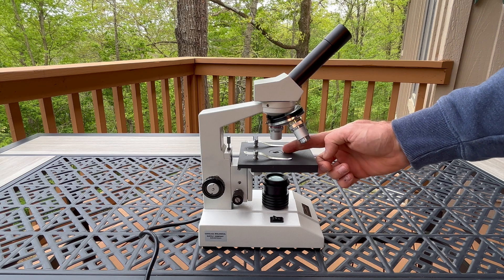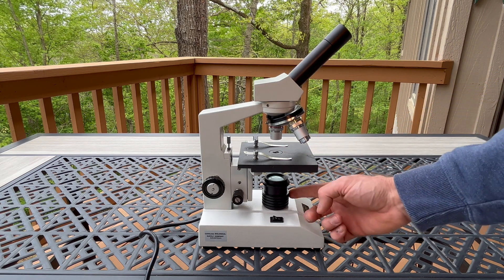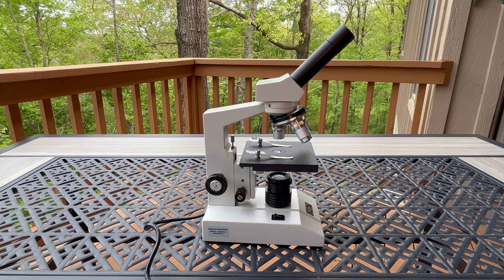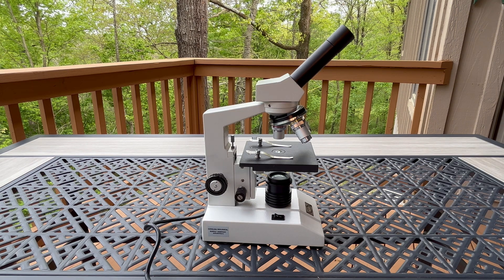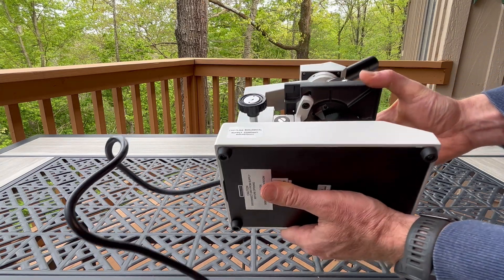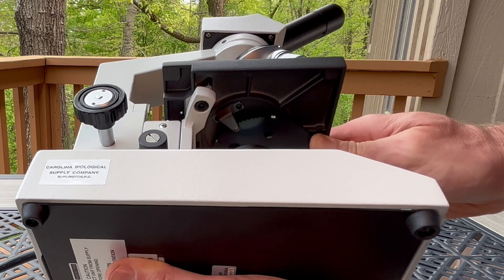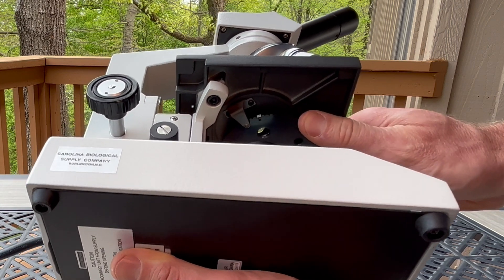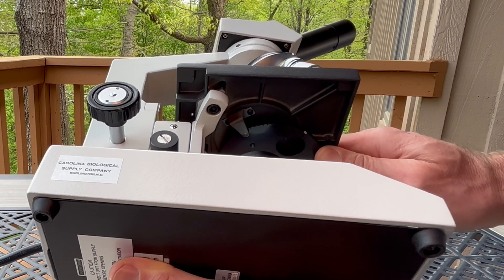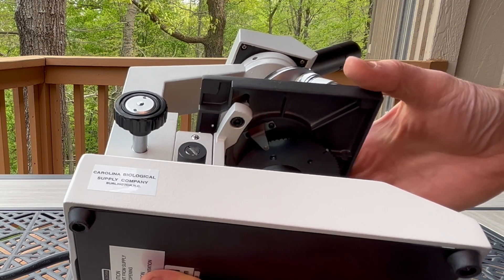Through the hole in the stage, a light will shine — this comes from the lamp. If you wish to have a different brightness of light, you will adjust the diaphragm. The diaphragm is a circular disc which spins, and as you spin it, it selects a different size hole to allow the light to shine through.